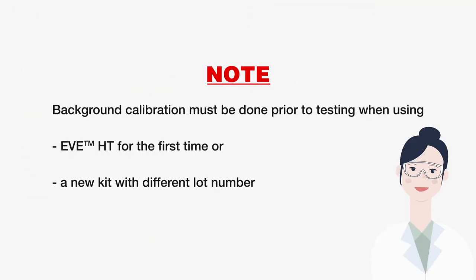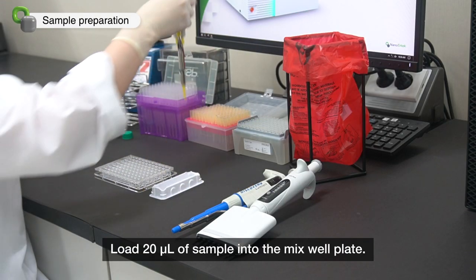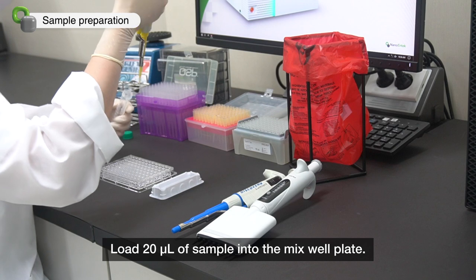Please note when to perform background calibration. Load 20 microliter of sample into the mixed well plate.